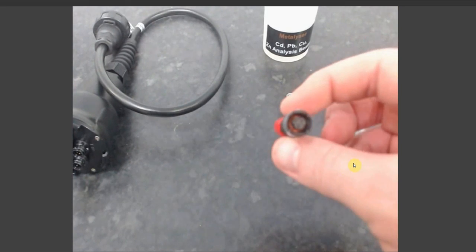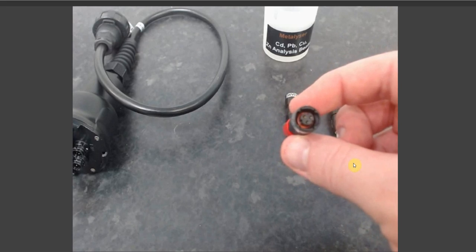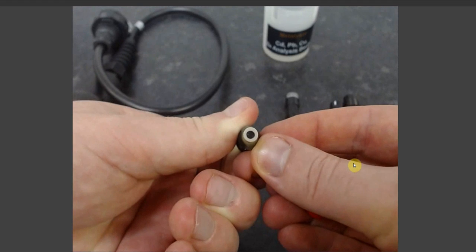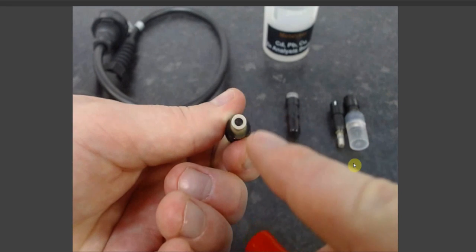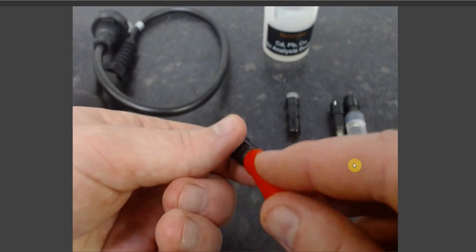There is then the WE2, which has 3 pins, making them easy to differentiate. Again, it is a standard glassy carbon electrode. There should be no scratches or damage to the black glassy carbon in the center of the electrode.